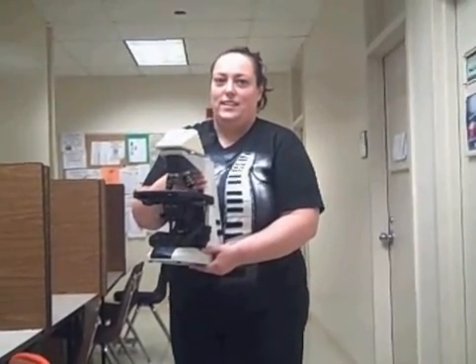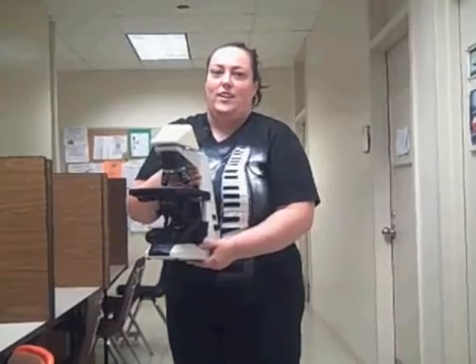Here's the first video on how to use a microscope correctly. I'm Dee Dee and I'll show you how to use it.